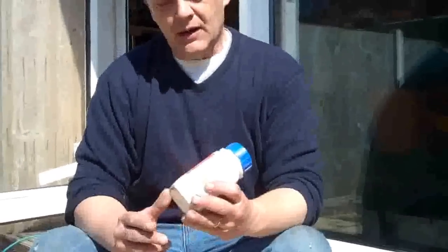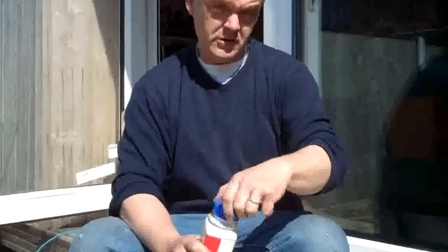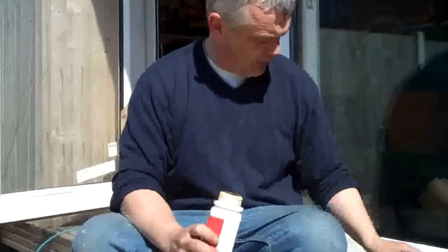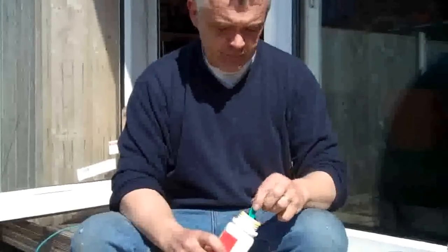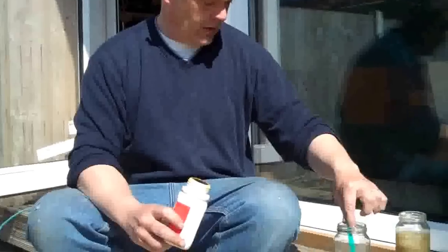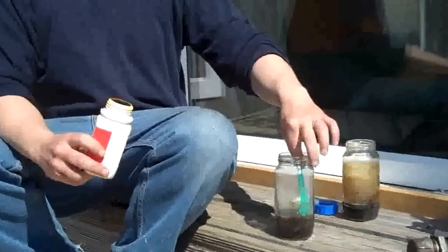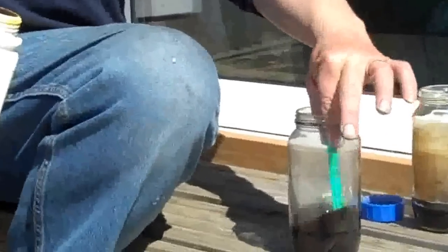In order to form iron nanoparticles, what you need is some kind of iron-salt precursor. I'm going to use iron-3-chloride, only because I've got iron-3-chloride. You can use iron sulfate and, I assume, iron-2-chloride as well. So there's lots of different things you can use. What you do is just get a little bit and stick it in your green tea. It's fizzing because it's anhydrous iron-3-chloride and that has a strong reaction with water.